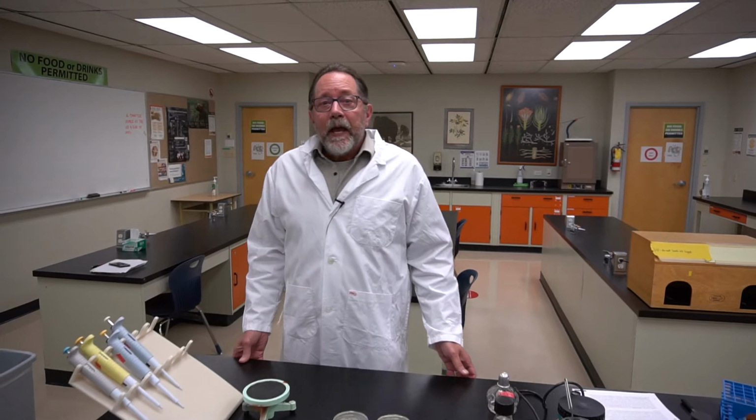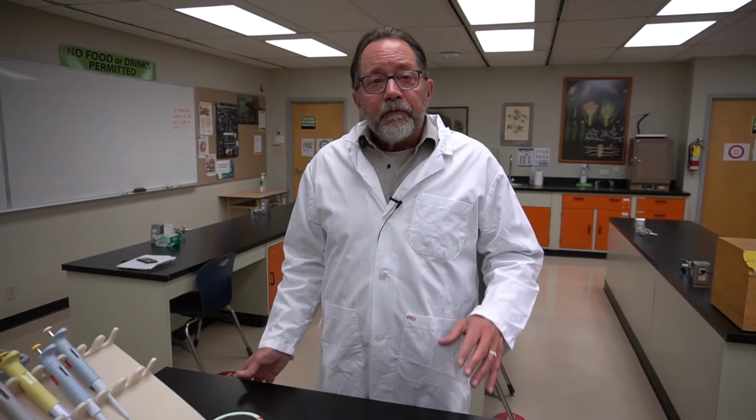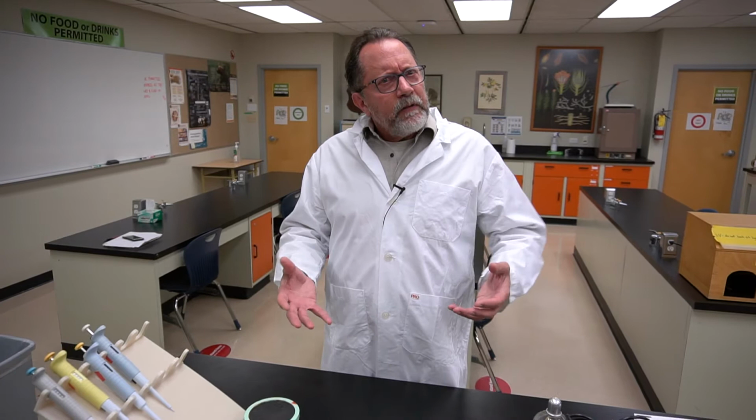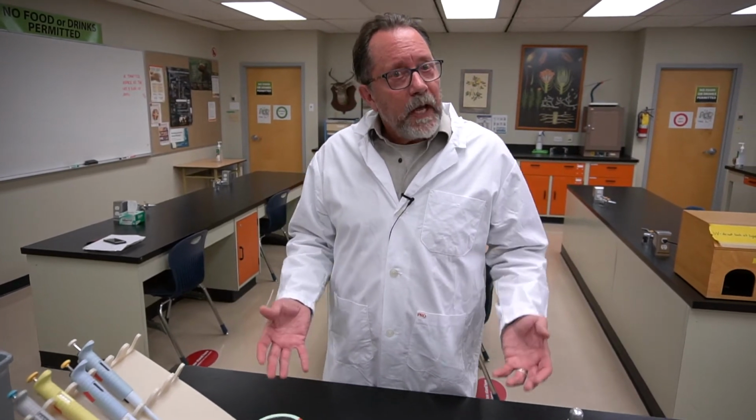Today we're doing Lab 8, which is UV reversion frequency in yeast. This is one of the most complicated procedural labs with some interesting calculations. I'll first be showing you how to make the plates that we're going to expose to UV light, about the background of the effects of UV light on cells, and then I'll talk about the kinds of calculations and graphs and questions that you'll have to answer in this lab exercise. Let's get started.